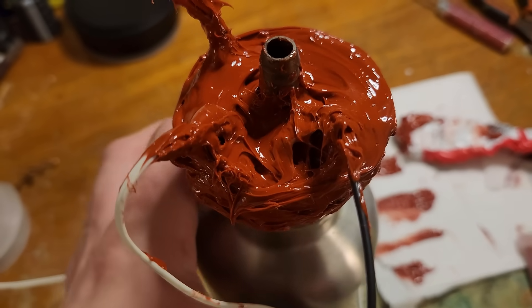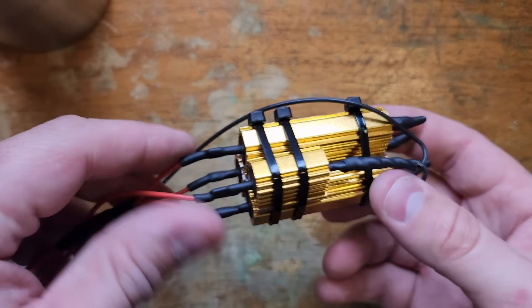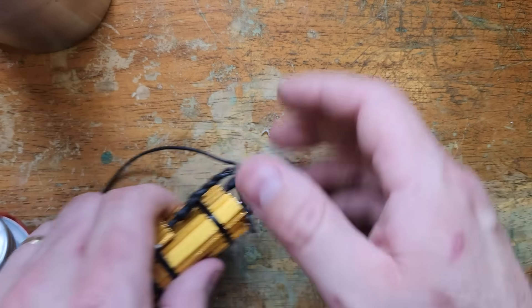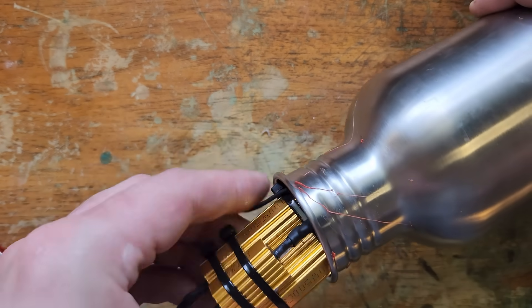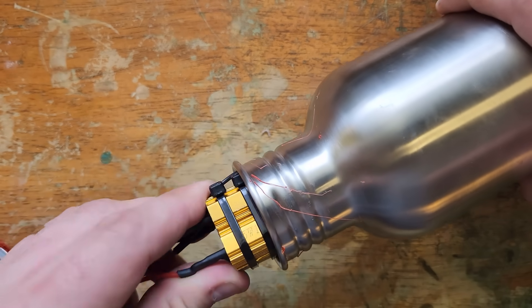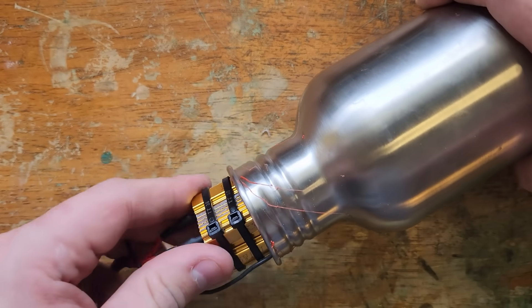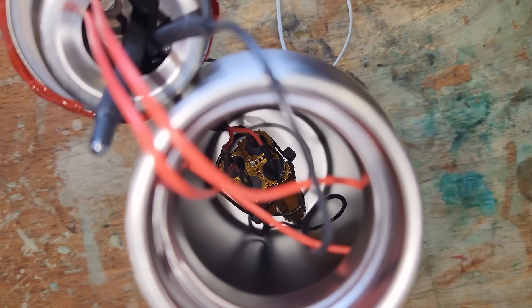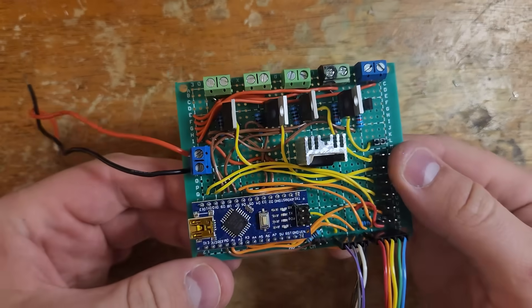Once the silicone is dry, I solder up the heater resistors. The big ones are 500 ohms wired in parallel, and the smaller one is 1 kilohm for the sustainer — but that only provides 15 watts on 120 volts, so I later replaced it with another 500-ohm resistor to provide 30 watts instead. The pack just barely fits through the mouth of the bottle.